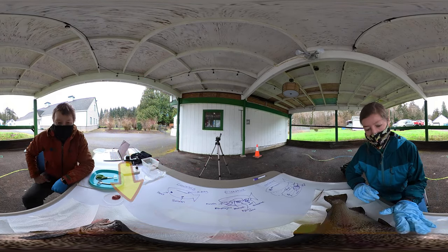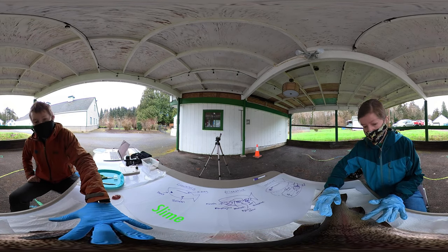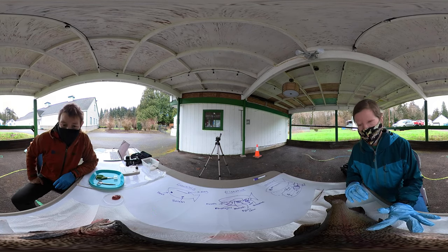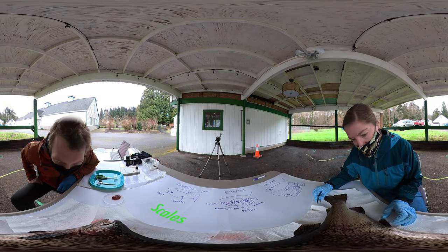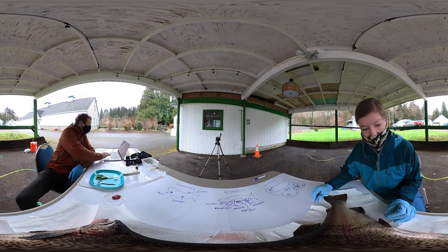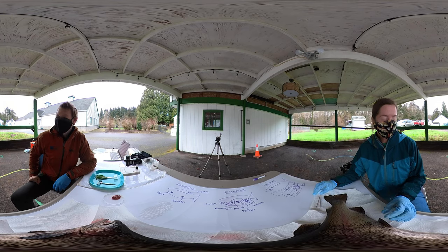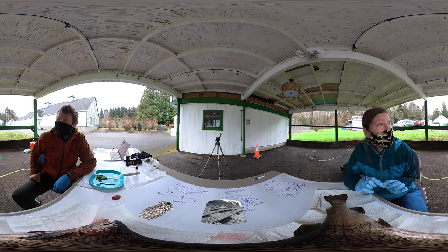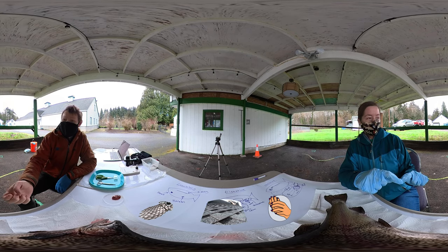So when I look at the external anatomy of a fish, I noticed right away a couple of things. One, how slimy it is. The slime has started to dry a little bit, but it uses the slime to protect its body so that it doesn't get bacteria or some parasites. I also notice all these beautiful scales. Maybe we can take a closer look at one of these scales. I think of the scales as kind of like a coat of armor, kind of like shingles overlapping on a roof. And they're made out of the same material as your fingernails. So if you hold up your finger and tap on it, imagine your whole body was covered in fingernails — that's what it would be like to be covered in scales.